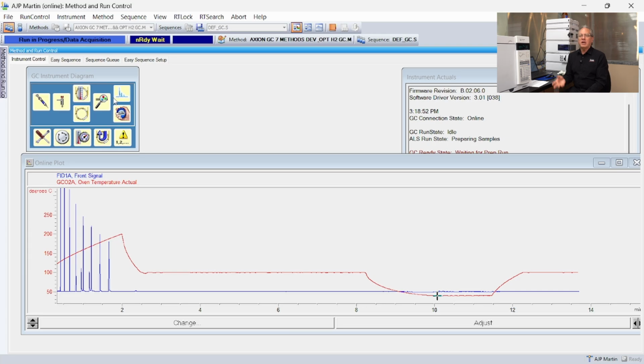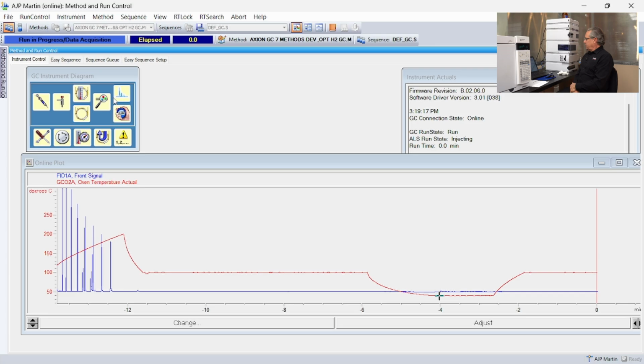To do this properly, I should heat it up, make an injection, throw away that injection. But I figure if I'm going to inject something, I might as well inject a sample so I can see whether or not the alcohols are tailing. So here's the GC getting ready. It's setting the flows, and so there's our injection. We reset the clock to 0.